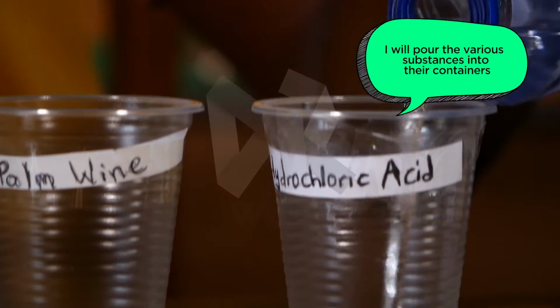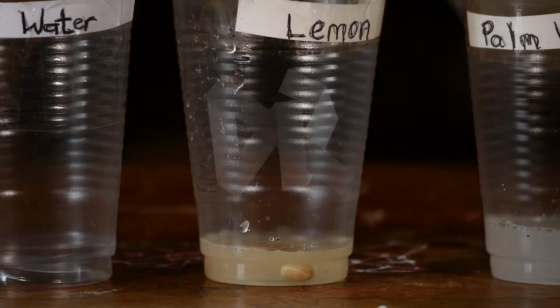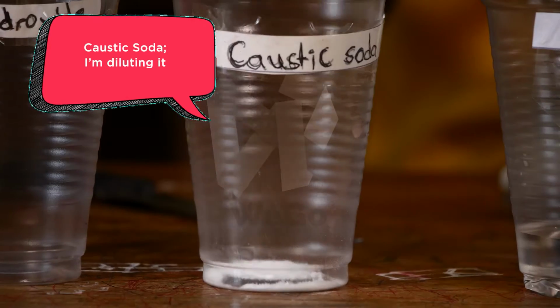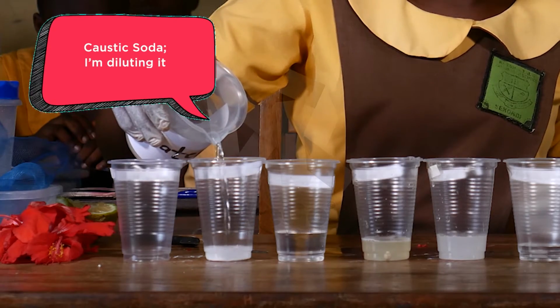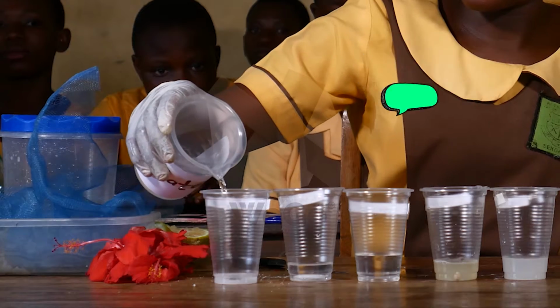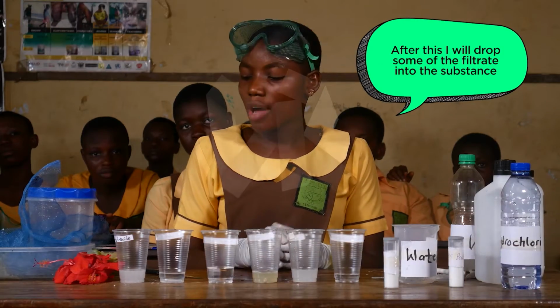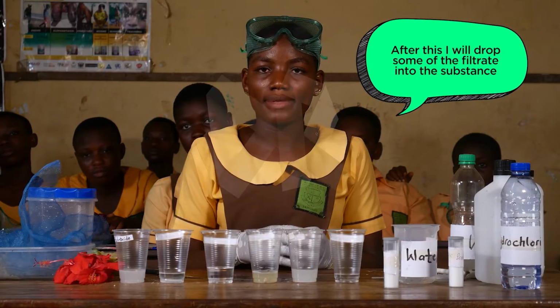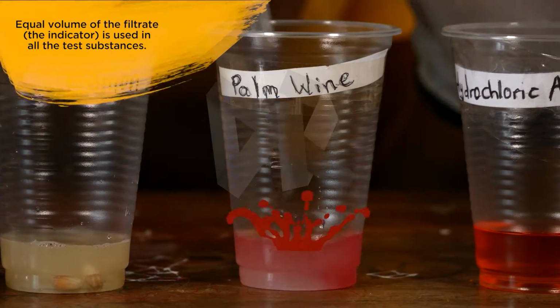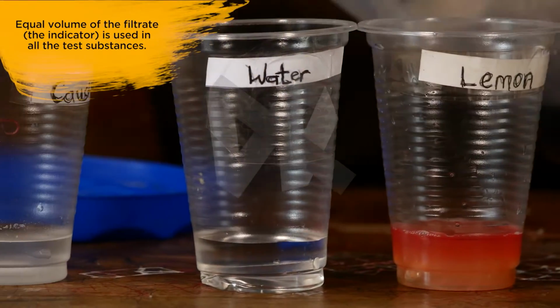I will pour the various substances into their containers. Caustic soda. I'm diluting it. Sodium hydroxide. After this, I will drop some of the filtrate into the substances. Equal volume of the filtrate is used in all the test substances.